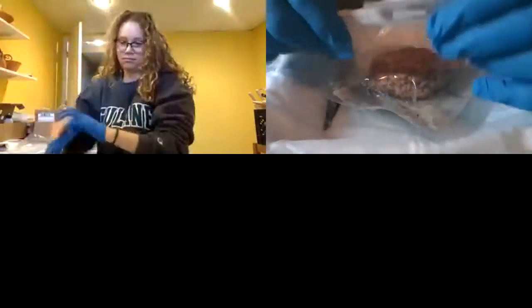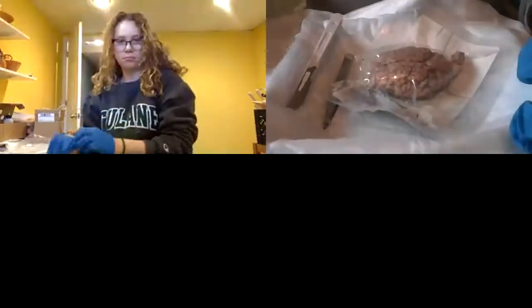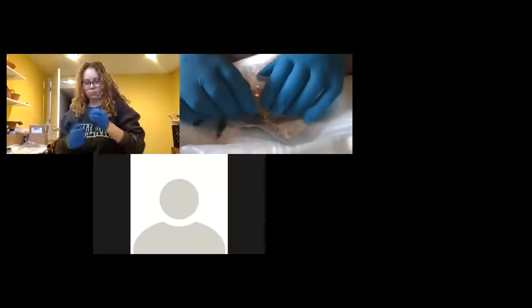Be really careful with the scalpels. The good news is these are probably really sharp, so keep it covered when you're not using it. You have your scissors. We're not going to use too much for this dissection. But the scalpel, it's really only one tool of the scalpel.